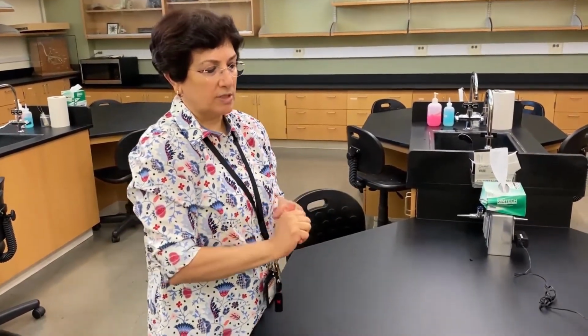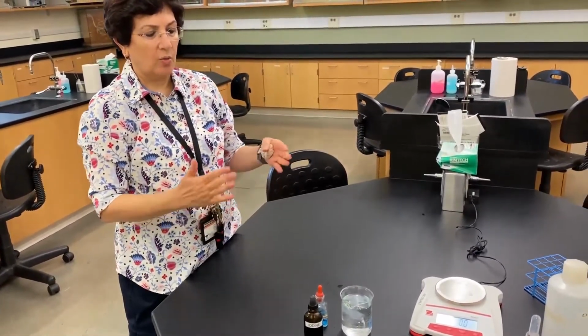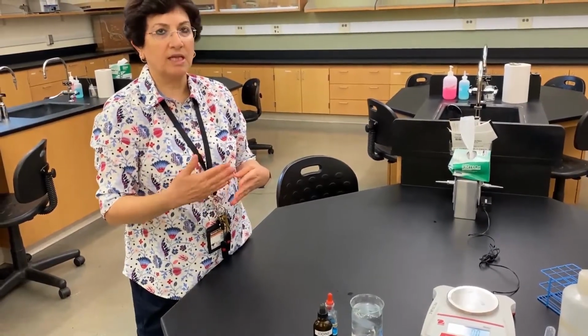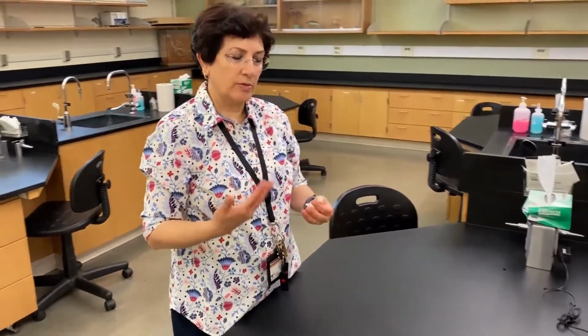And after 2 hours of the dialysis bag soaking, we'll continue with our experiment, and I'll explain more about the tests that we are using. While we're waiting 2 hours, we're going to set up the osmosis in potato experiment. And again, as we go through this experiment, we're going to explain the steps, the objectives, and then come up with some hypotheses. And I will tell you how we are running this particular experiment.